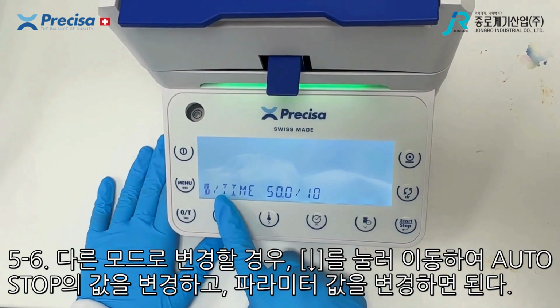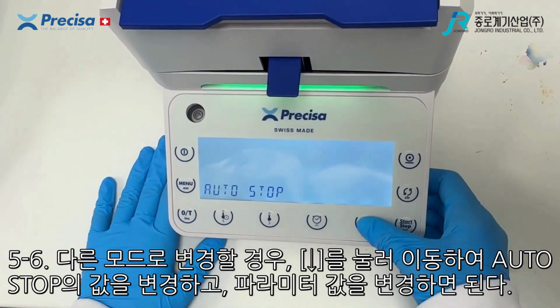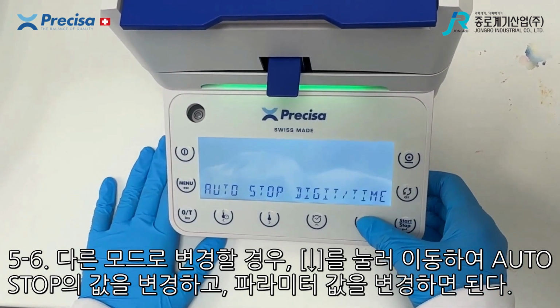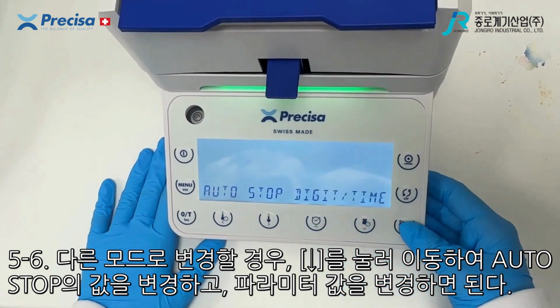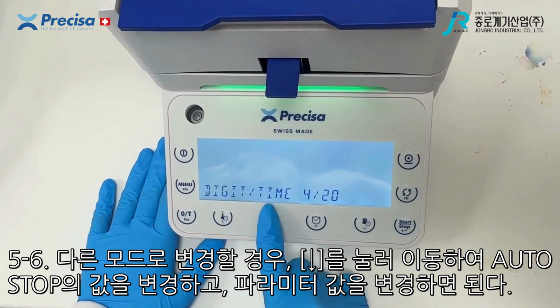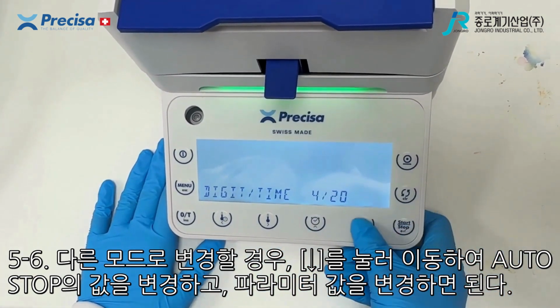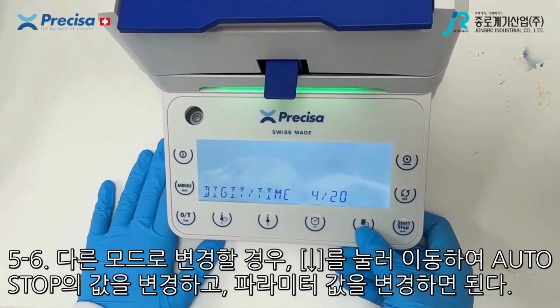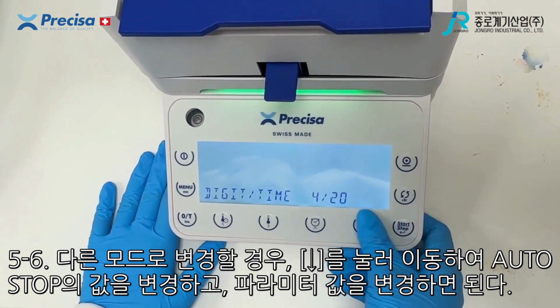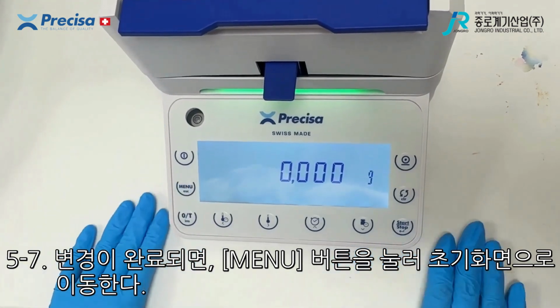If instead you want one that's not percentaged over time, just scroll down and you can press enter and scroll down to the other options available. If this is the one you want, then you can press start, scroll down, and now it's going to give you the digit over time stop parameters. To change this, press start, and you can scroll down until you find the one that's right for you. To save this, press start, and now you can go back to the main menu.